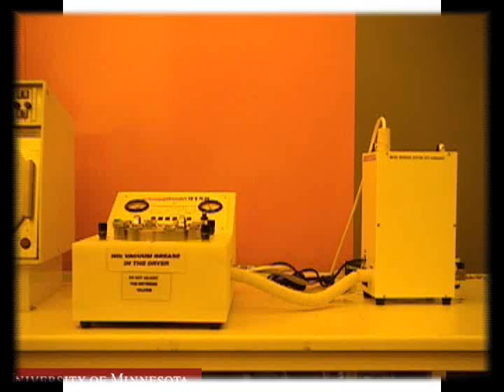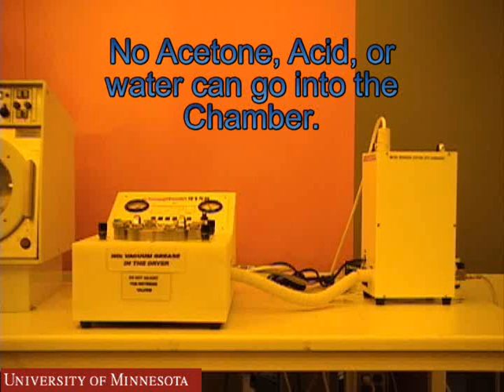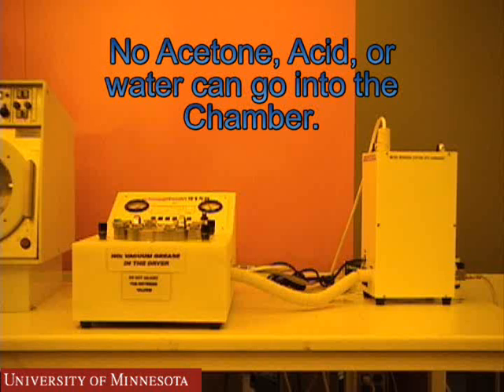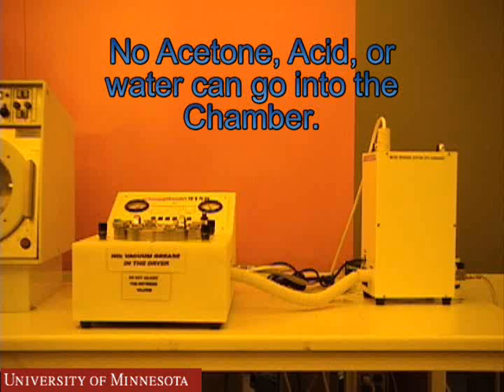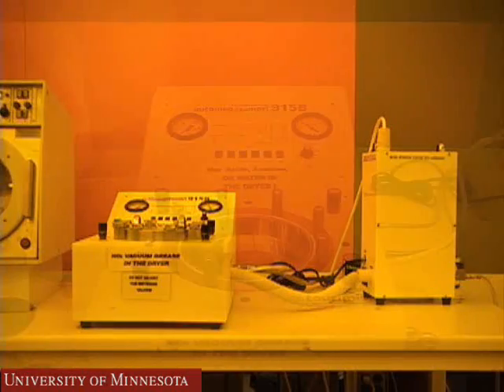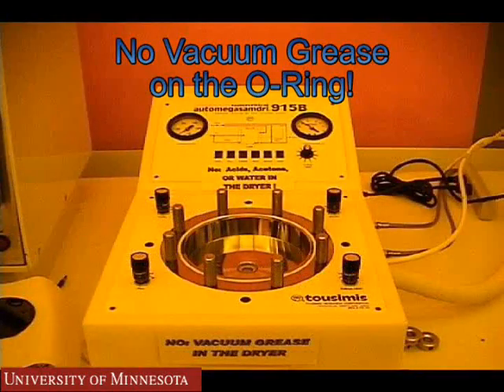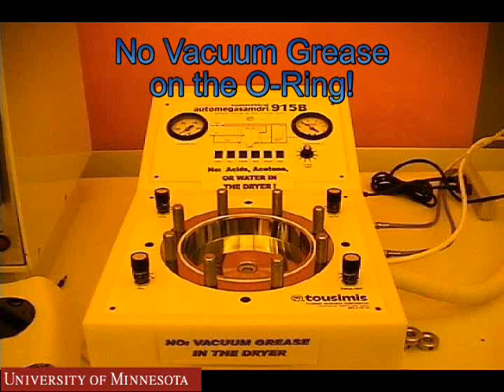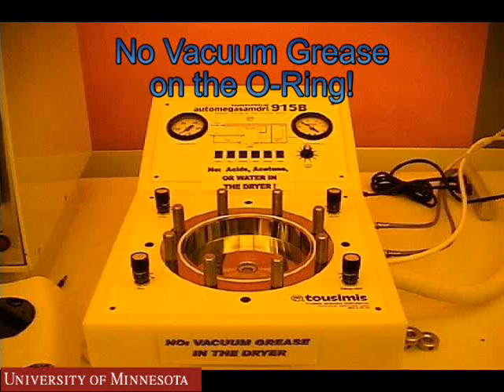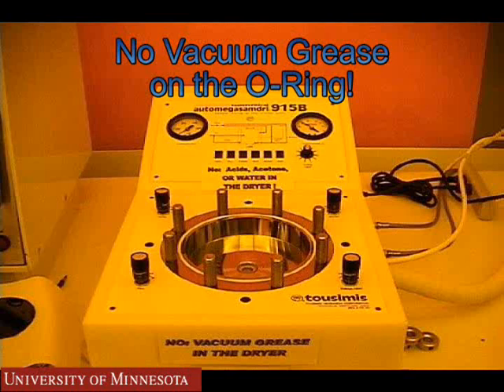There are two main restrictions when using the CPD. The first is what cannot go into the chamber. No acetone, acid, or water can go into the chamber, as these will damage the CPD. The second restriction is no vacuum grease on the O-ring. The O-ring is made of Teflon in order to handle the high pressures which the chamber will reach. The chamber is never under vacuum.